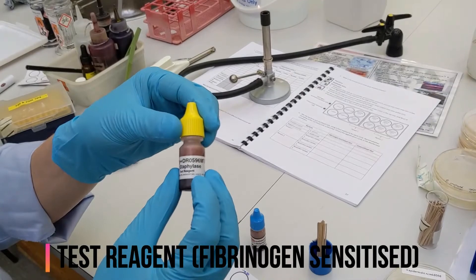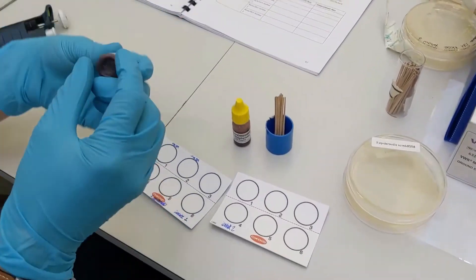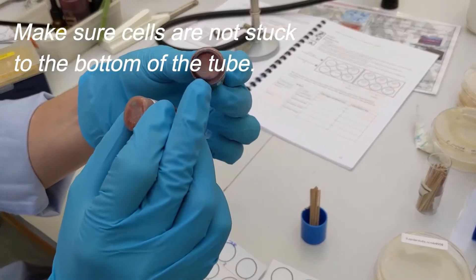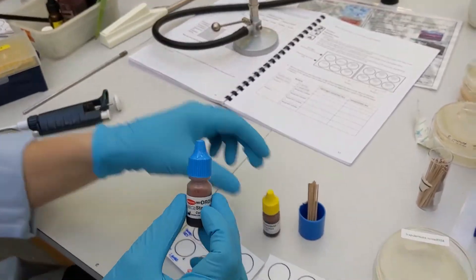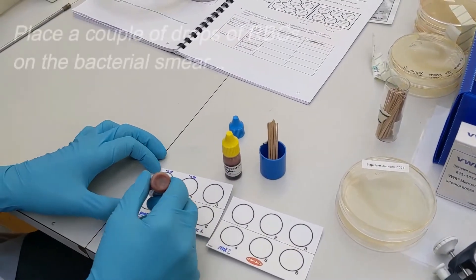It is important to mix the blood reagents first, as the cells can sink to the bottom of these tubes. The test reagent is fibrinogen-sensitised red blood cells, and the control reagent is red blood cells without fibrinogen.